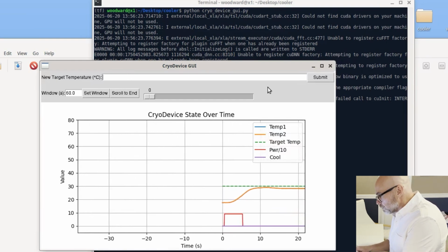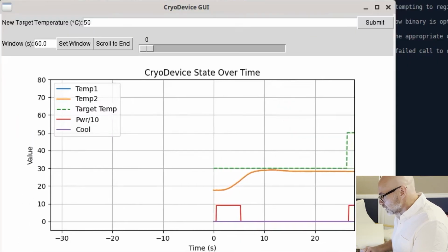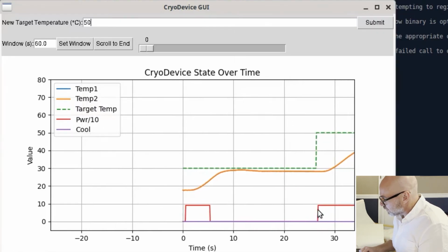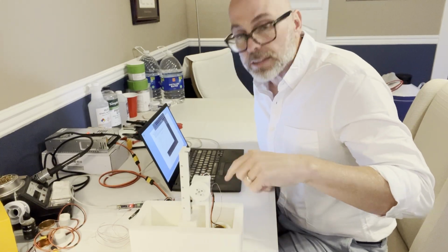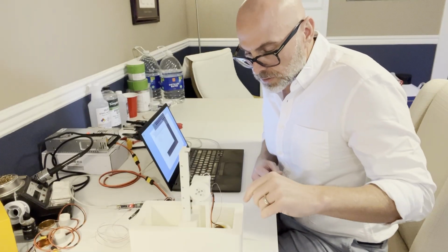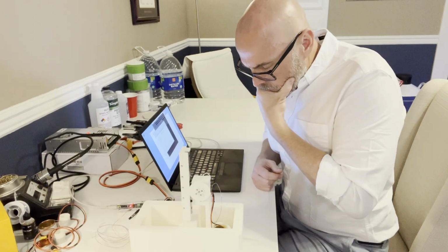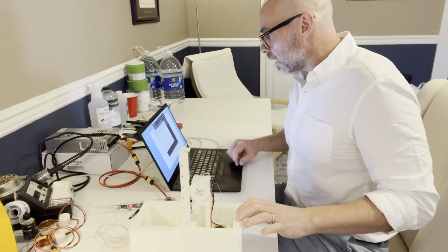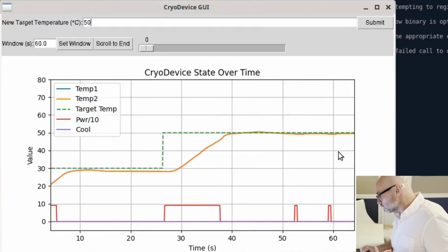But it's holding it there, and now we can command it to go to, let's say, 50 degrees. So we'll command it up to 50 degrees. The controller sees that target temperature, turns the power on. That's this power on, and then we're rapidly warming up. I can kind of smell it. Actually, I don't know why I can smell it. I think it might be some of the thermal adhesive that I'm using that I'm able to smell when the nichrome comes on. But yeah, it does a great job. Comes up, holds it really well, and then gives these little pulses.